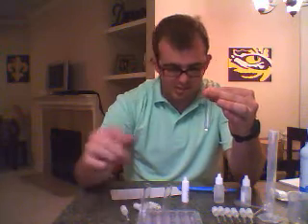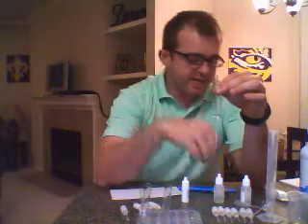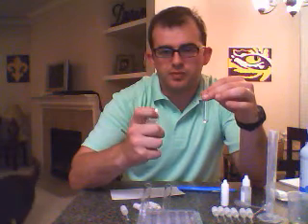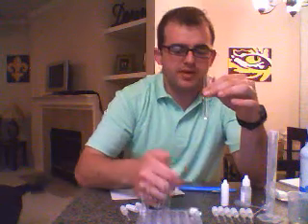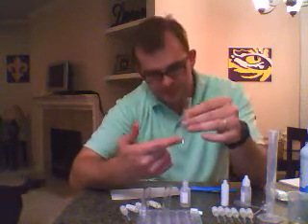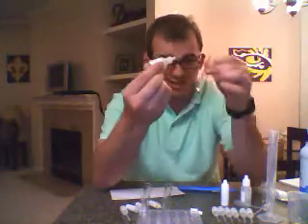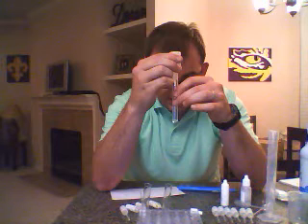Set that there. Alright, we have 8 drops, and what we're going to do now is add 8 drops of hydrochloric acid. We're going to see if the appearance changes, see if there's going to be a color change, or we're going to be able to see gas coming up the tube or any precipitate forming. So we're going to pay close attention here as we do this. Make sure we try not to get any on the wall so it gets just contact with the liquid.